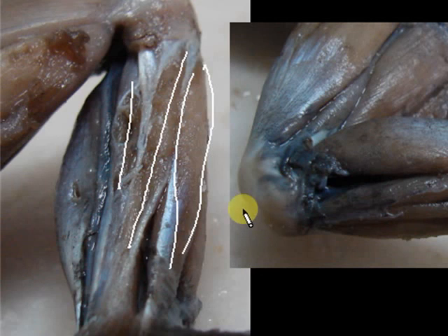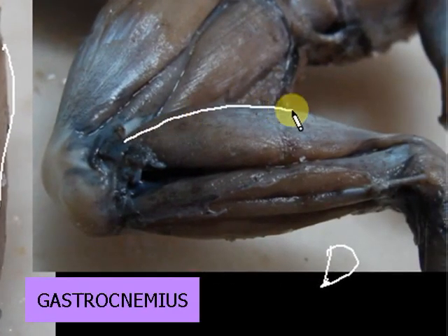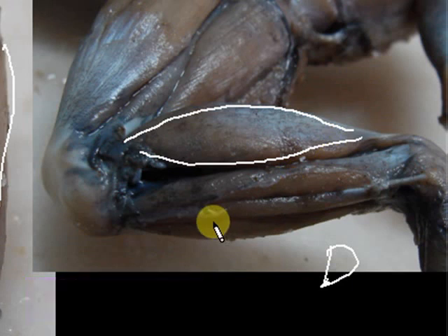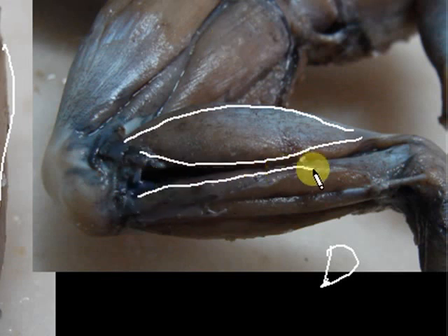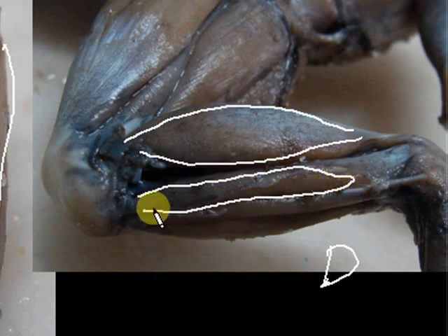And then this big muscle here, you might be confused, that is the gastrocnemius. It can be seen ventrally, and it can also be seen dorsally. From the name itself, gastro means stomach, because if you look at it, it looks a bit like a stomach. And then this muscle right here is the peroneus muscle, which can be seen dorsally. And that's it. Those are the muscles of the shank.